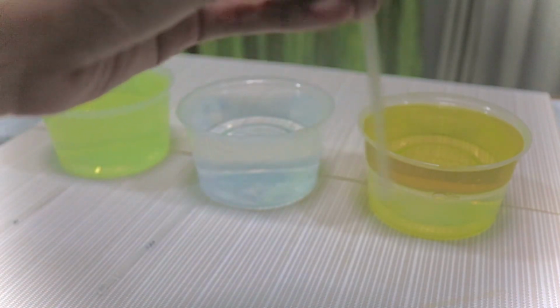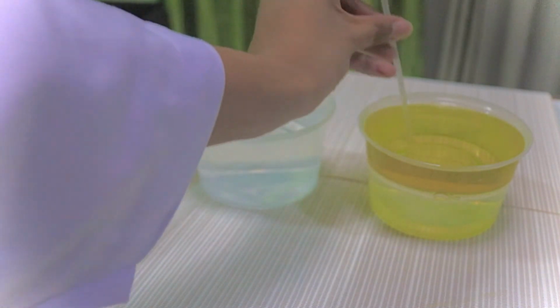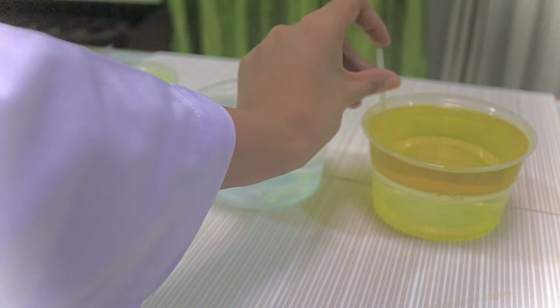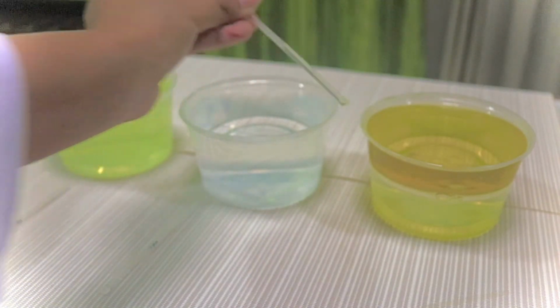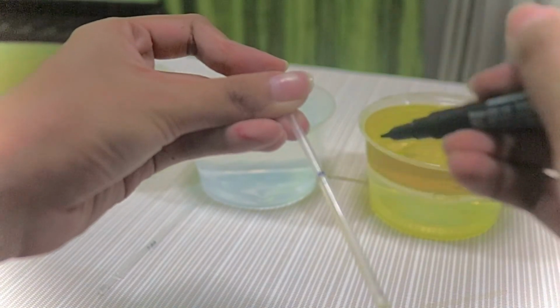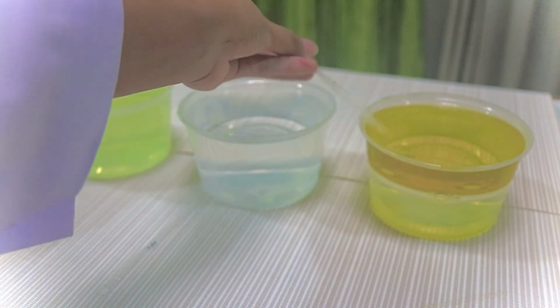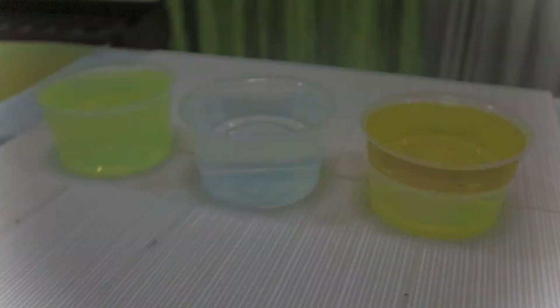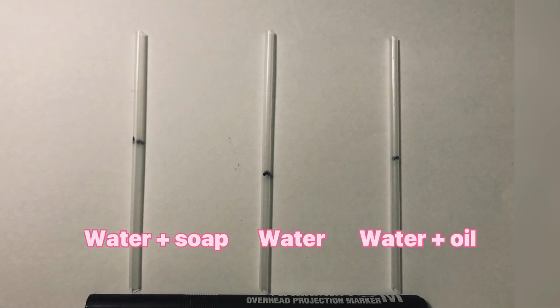And the last is the water mixed with oil. Like the previous, I place the straw perpendicular to the surface and allow the liquid to rise up through the straw. And then I mark the level of the liquid in the straw. So, this is a comparison of the results of the different solutions: the mixture of water and soap, water, and the mixture of water and oil.